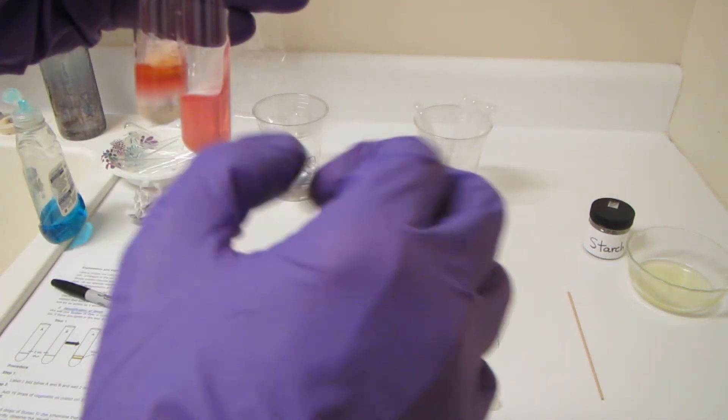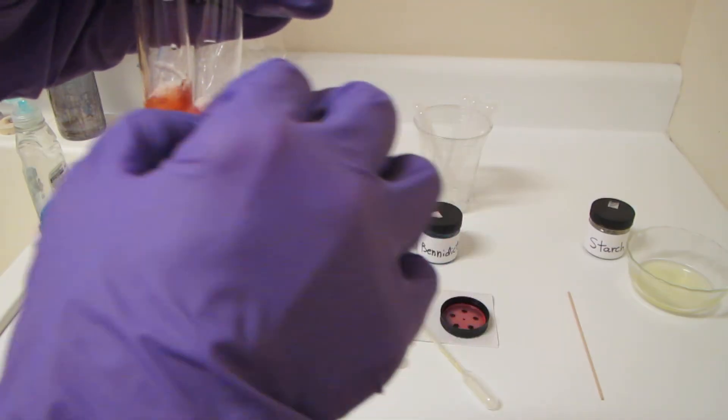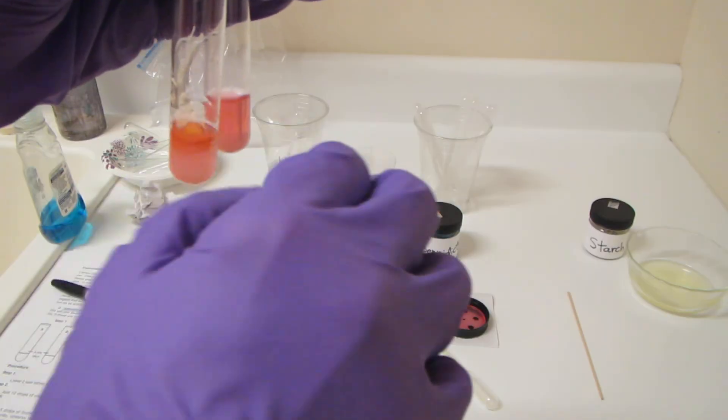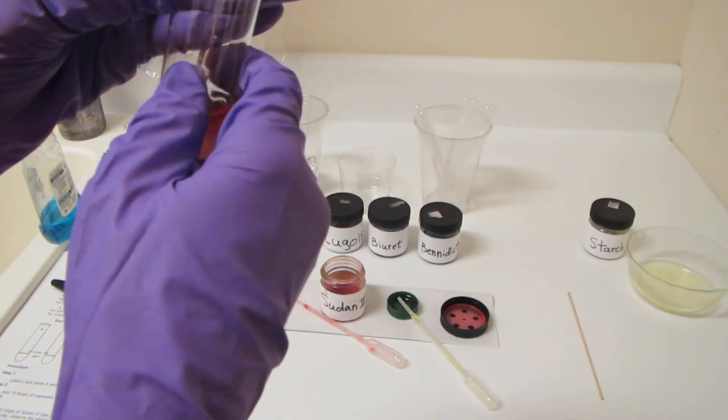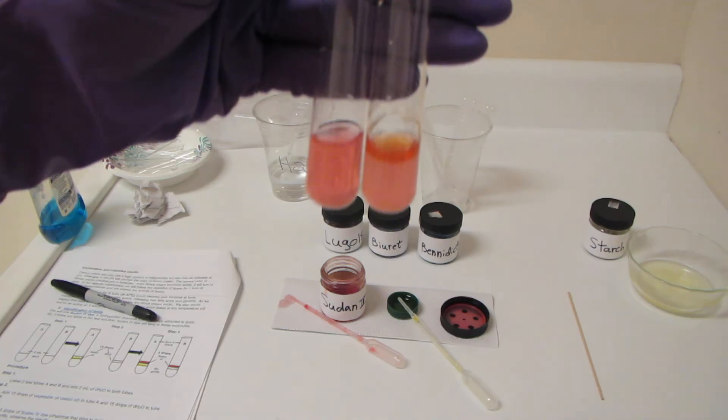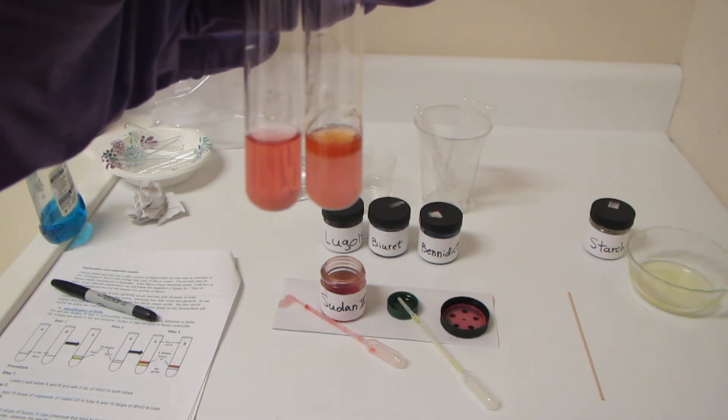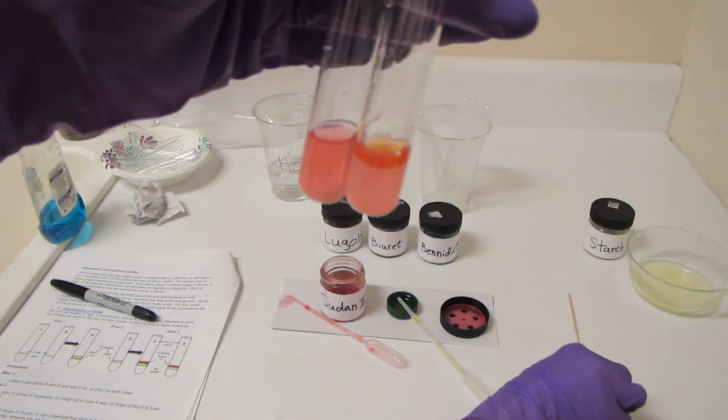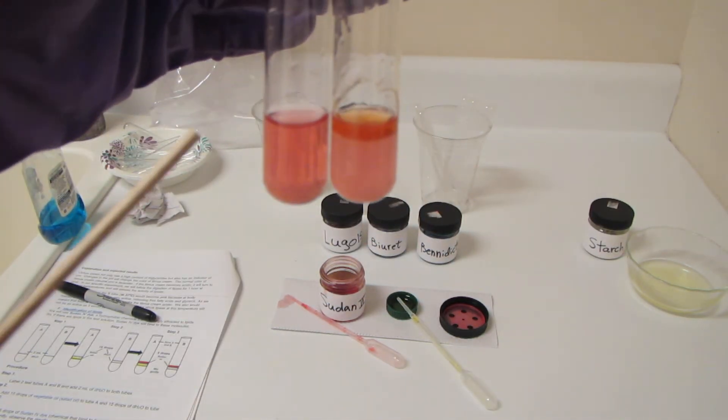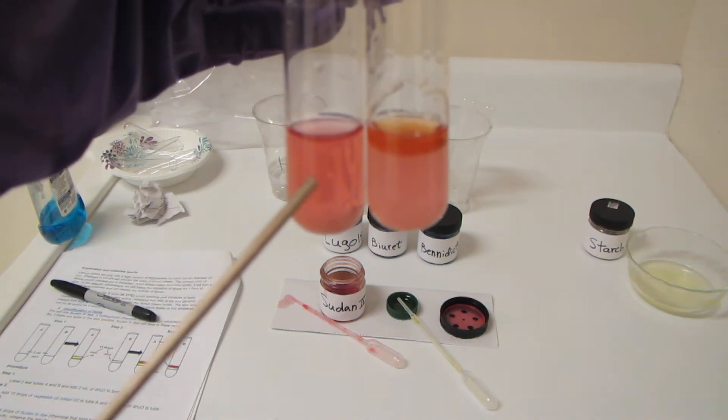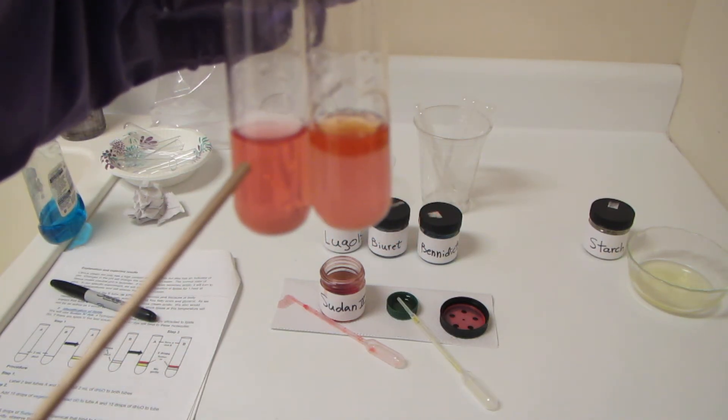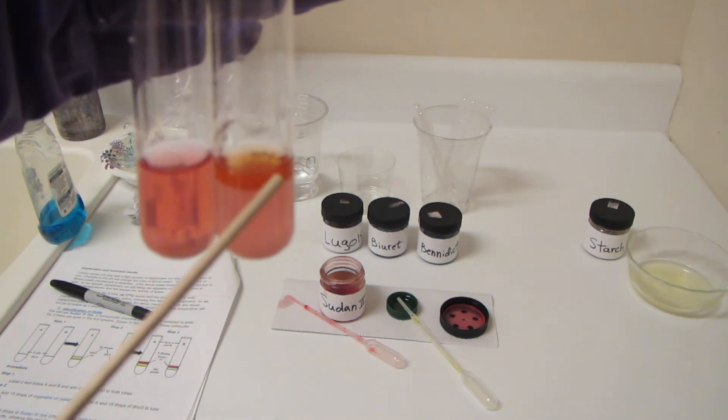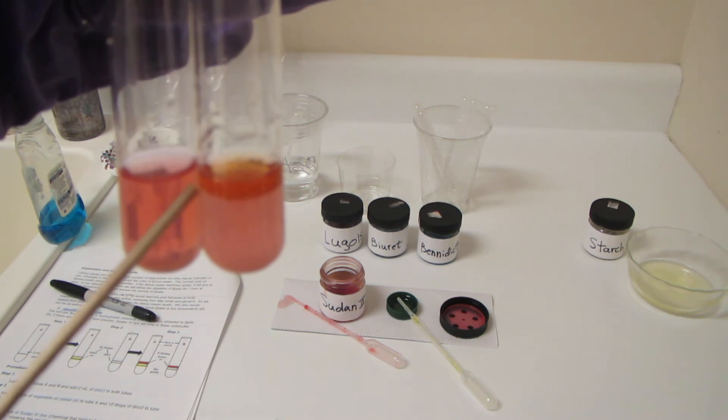One of the fastest ways to mix things in a test tube is to go ahead and do what they call the clinking method. So now I have my two test tubes. If you take a very close look at them, you can see this test tube here is one uniform color. This test tube here is starting to develop a very dark ring along the top.